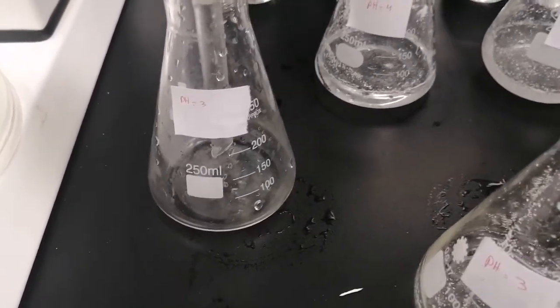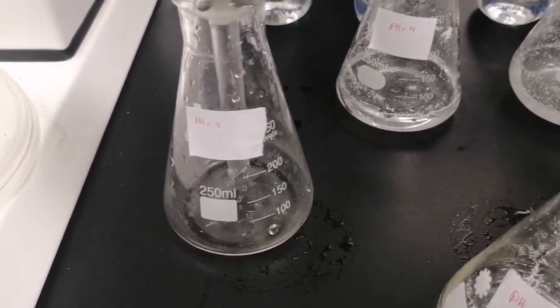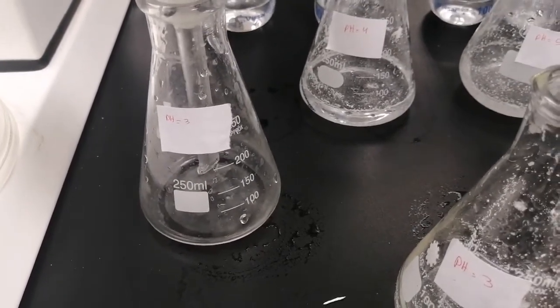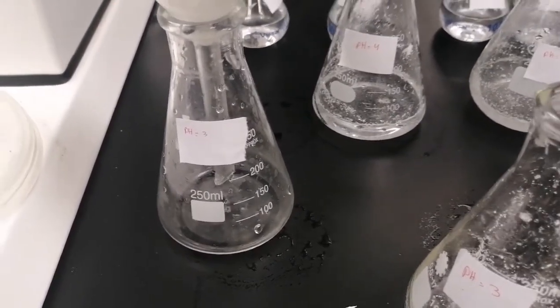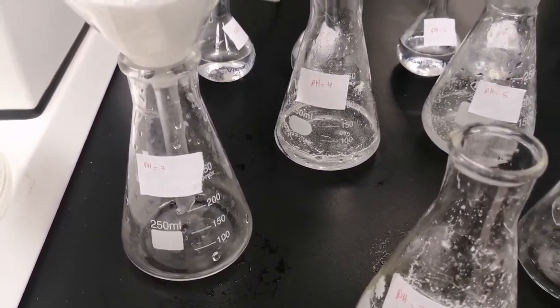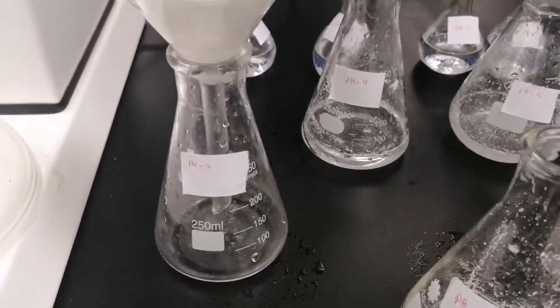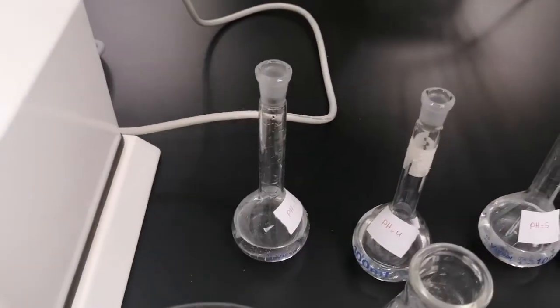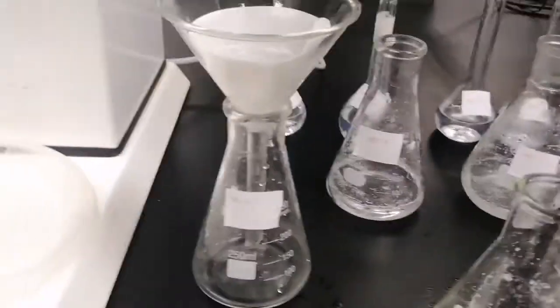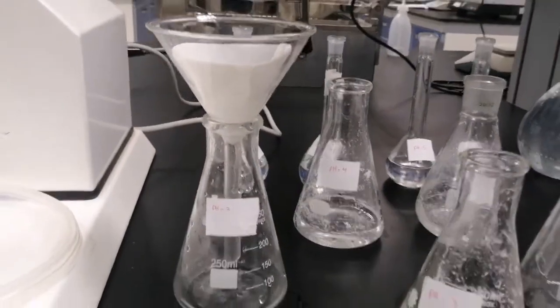After that, we will measure the absorbance of these solutions, of different pH solutions. If there is any absorbance above 1 or 1.5, we need to dilute it with 0.1 molar sodium hydroxide. The blank of each of these solutions will be the buffer of that pH. As in the pH 3, the blank will be the buffer of pH 3 prepared first, and for pH 4, it will be the pH 4 buffer. So every blank will be different between measuring the absorbance. It won't be the same blank in measuring the absorbance of each solution.